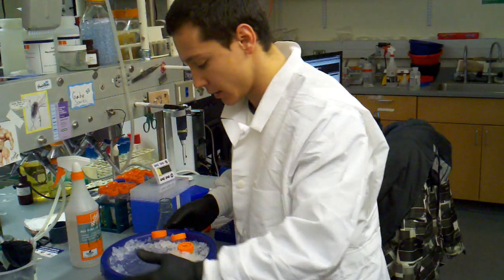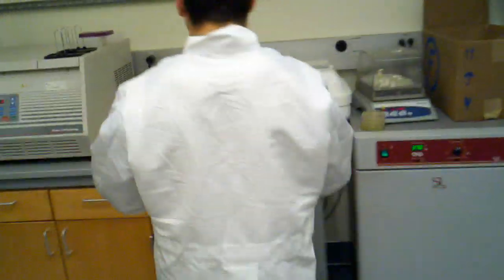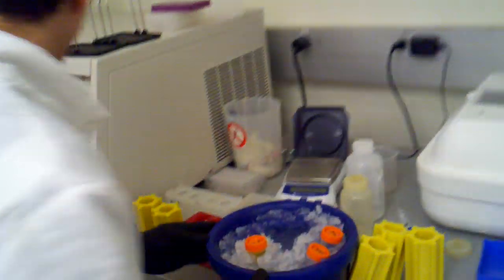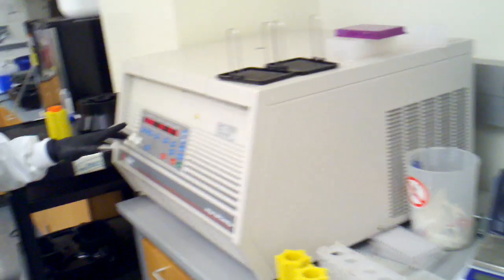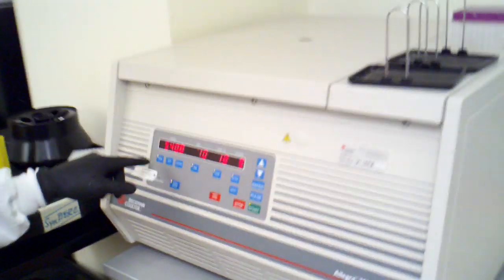Now we're going to spin it down so we can bring our little ice bucket over here. And centrifuge is at 19 degrees right now. Sounds like a couple more degrees to go but that's okay.